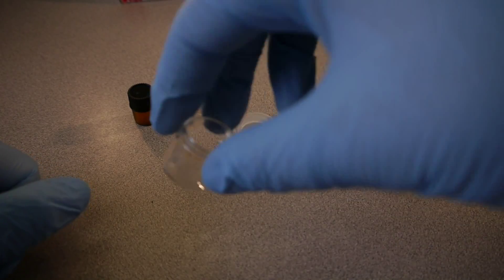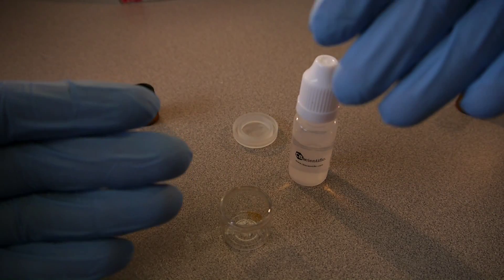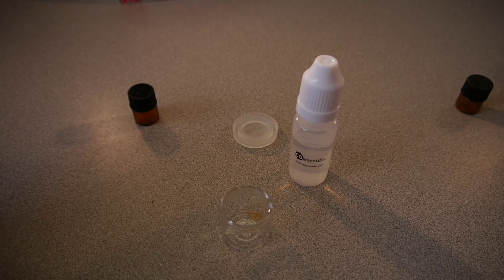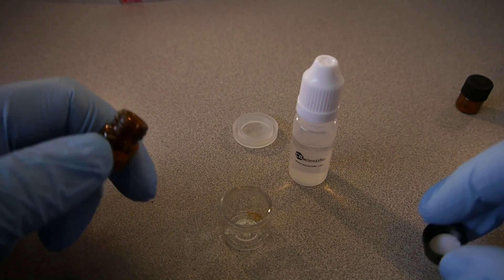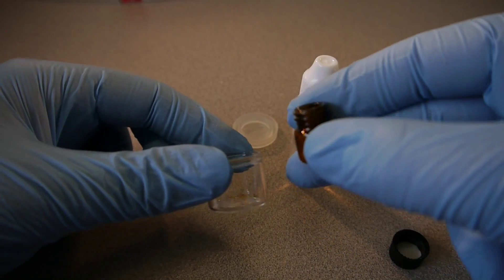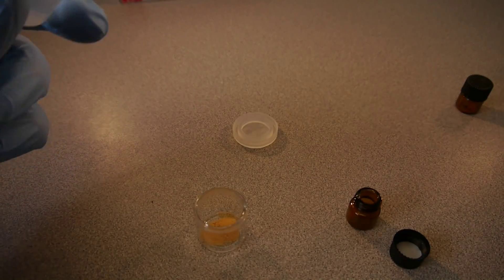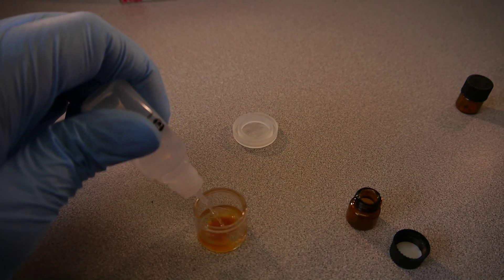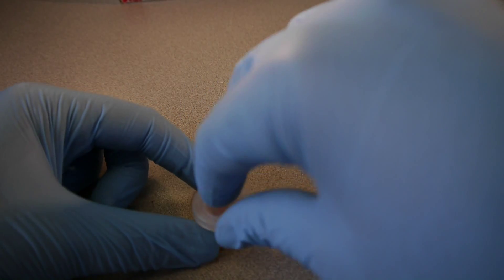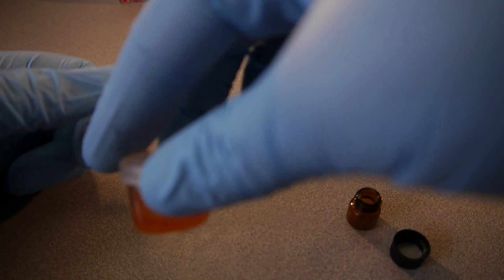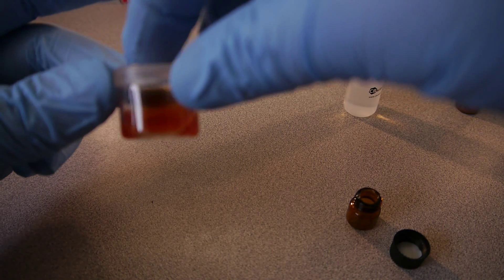The edibles does require a little bit more because the solvent that does strip off the rest of the food particles on the edibles is a little stronger than the solvent in the THC detection kit. So, and the dye solution is also engineered just specifically for this detection kit. They are very similar, though, since they do detect for THC. So we're keeping things chemically similar. So we pour our dye solution inside, and then we pour our solvent inside. And that's a good amount there. Again, you want to leave solvent for about three detections, if that is your plan, to do three detections.